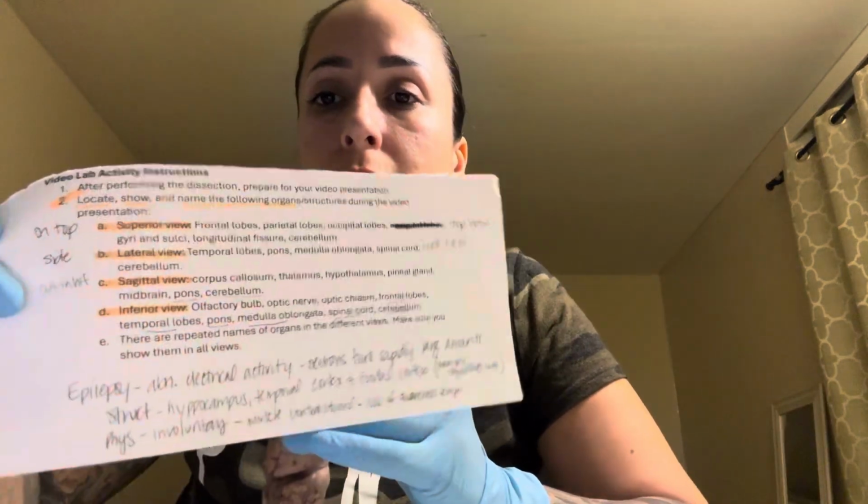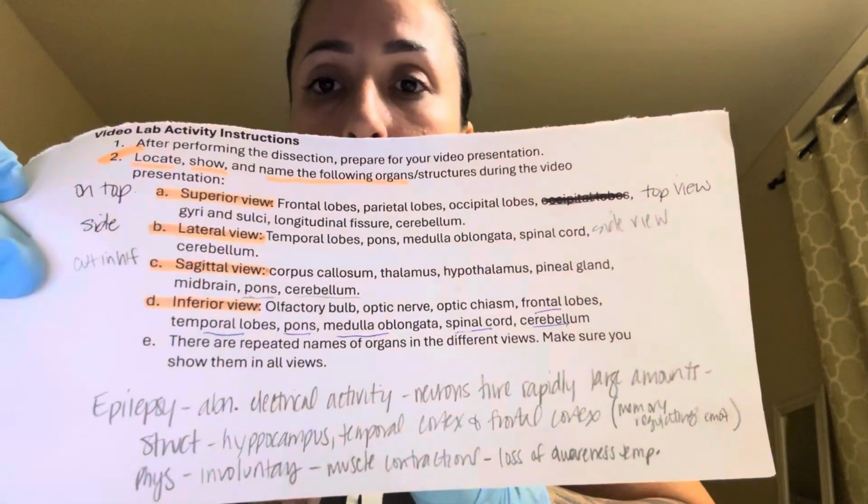This is my anatomy and physiology video for the nervous system, the sheep brain. It is Sunday, October the 20th. I do have this to keep me on track. So if I look down, it's because I am looking at that.